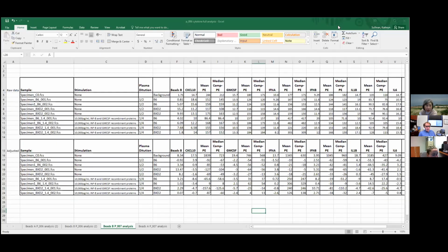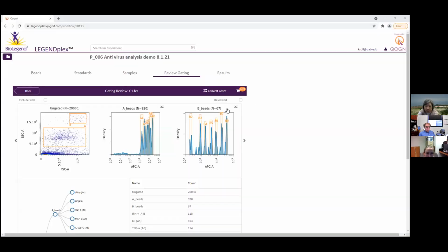But wait, before you do that, let me just say this. If you go back to the histograms you were just showing, can you go back to that? Yes, I will. Can you get out? Escape my share. What's going on? I can't escape the share. Really? Let's see. Oh, there we go. Okay, go back to the histogram thing you were just showing.